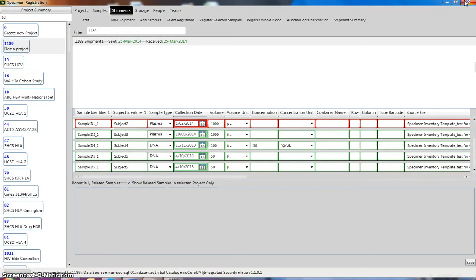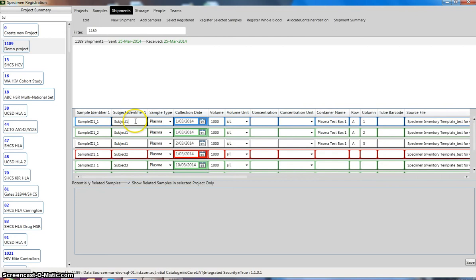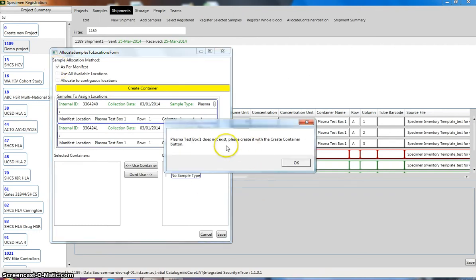Alright, so we can close this, and the next step, once the samples have been registered, is we allocate them to containers. So if I select the first 3 samples, you go allocate container position, and we select as per manifest because those are the positions we would want the samples in. You click on as per manifest, and this will come up saying if this is a new container type and we don't have it, then it tells us to create one. So we'll click OK, and it will come up for all the samples that have the same container type.